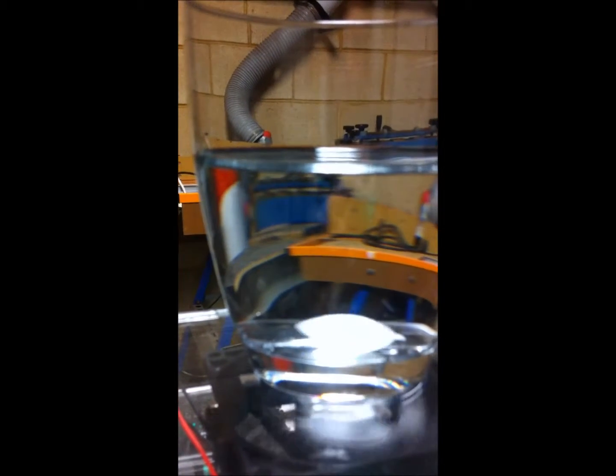This is a little device that would cost maybe $30 to make, depending on how much acrylic you've got lying around and how much assistance, or less. The parts for the board are very cheap if purchased from eBay.